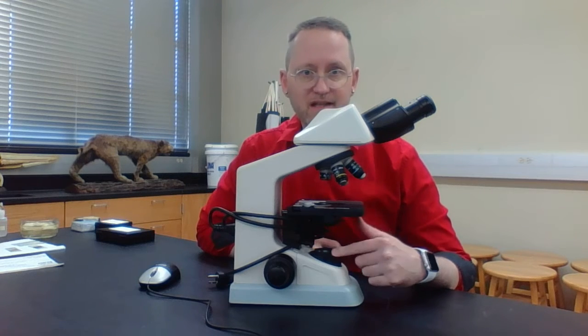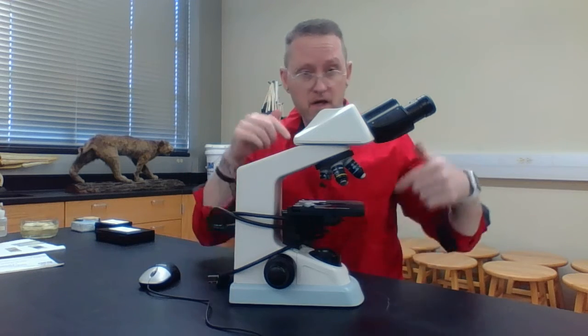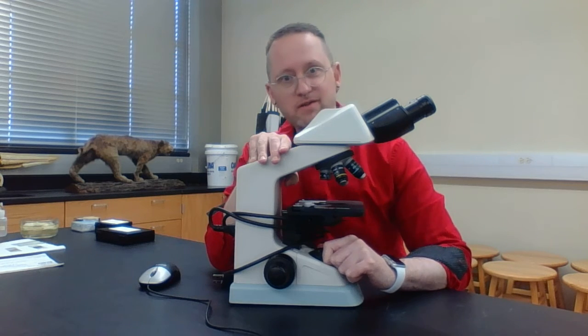Well, it depends on our light source, because the light is actually going to determine the resolution. So anything smaller than 0.2 microns is going to appear as one object. Anything that's larger than 0.2 microns is going to appear as two objects. So although we can magnify it, magnify it, magnify it, because we're using visible light as our light source, we're not actually increasing our resolution.